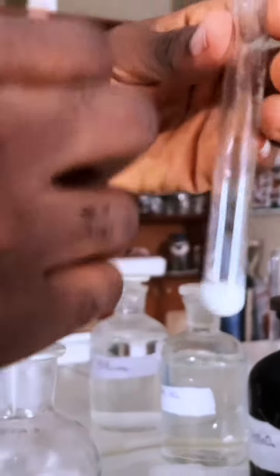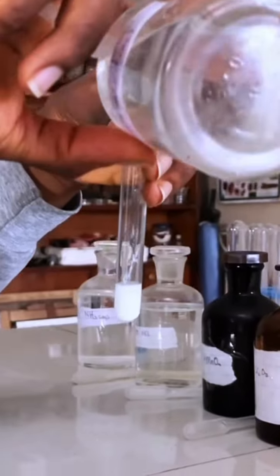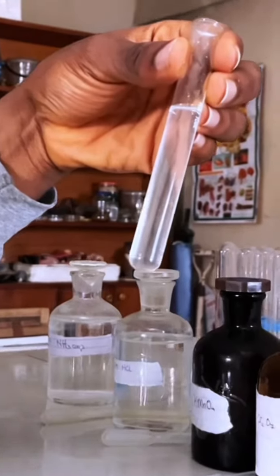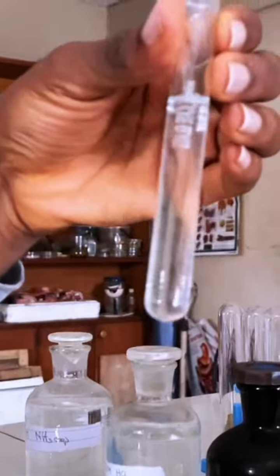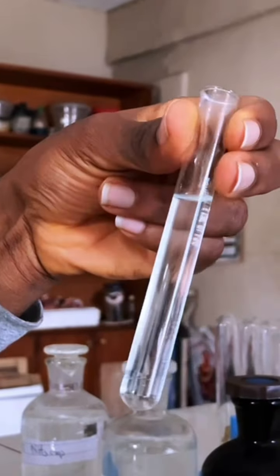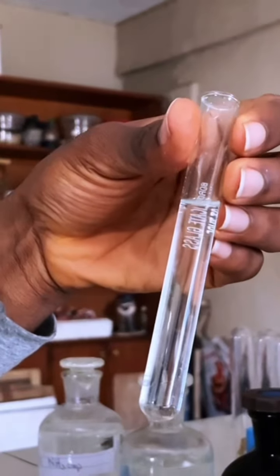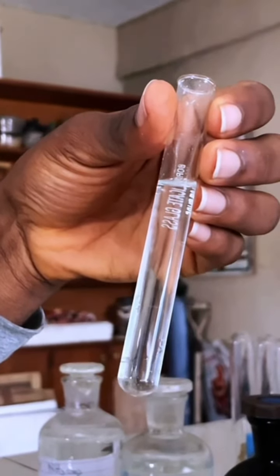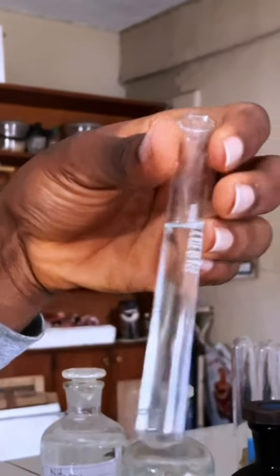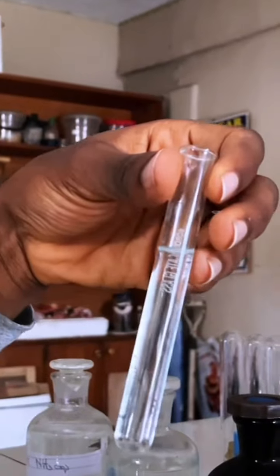So if I put it in excess, wow, you can see everything dissolved in excess. So for now, you see that in drops there was a white PPT, and then in excess the white PPT cleared. Now you are suspecting some ions, right? And if you notice, the PPT was chalky, so we're expecting calcium or lead ions. If it's gelatinous, it should be aluminum or zinc, but this was chalky. So our observation would be that a white PPT was formed in drops and it dissolved in excess.